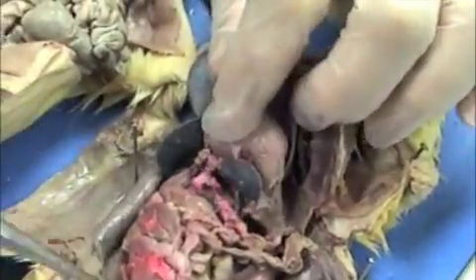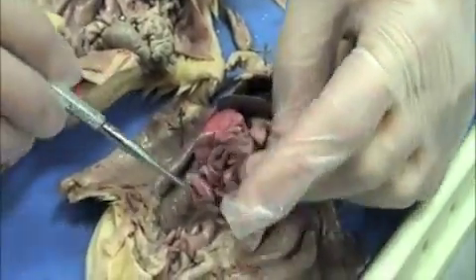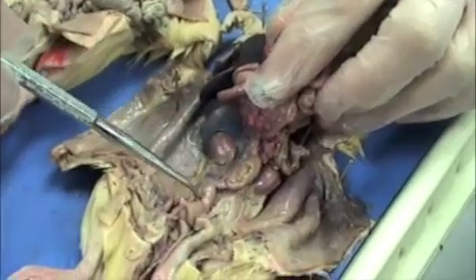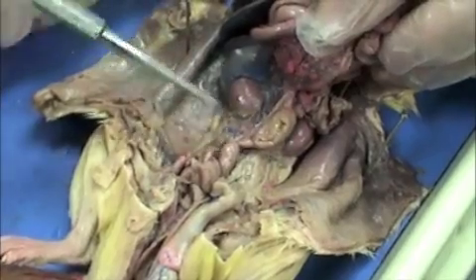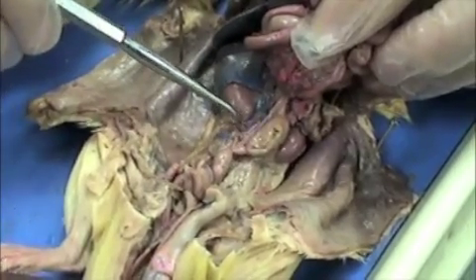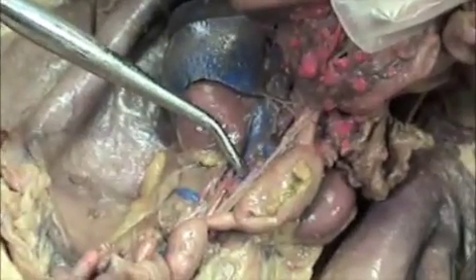Here is your small intestines. Here's that big large cecum again over here in the middle of the intestines — that's the first part of the large intestines. If you raise it up, you can see the kidneys. This is the last part of the large intestines. Here you have connective tissue over the inferior vena cava, and there is the abdominal aorta right beside it in pink — it's supposed to be red, but it's pink.